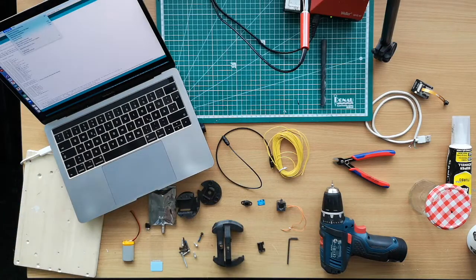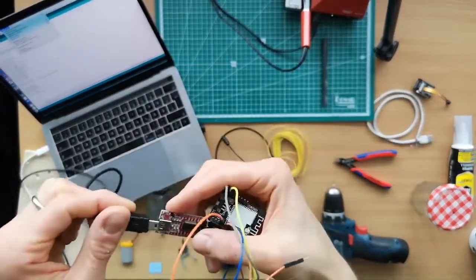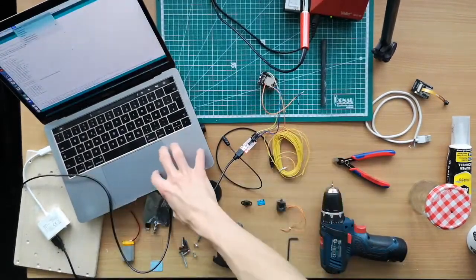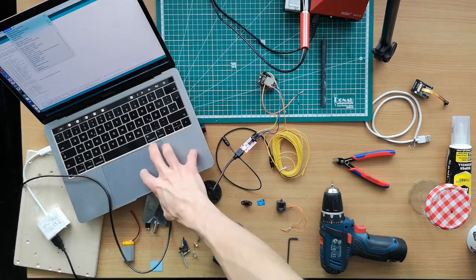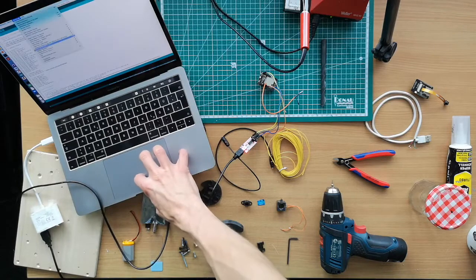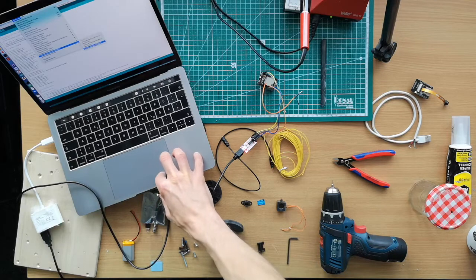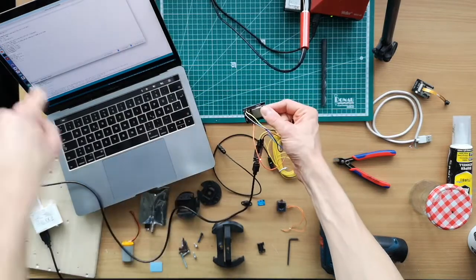In this case, it's a Mac system, but you can use any system there is. And I'm just doing that. So here we have the USB wire, and if everything goes right, we can start the serial, and then we can have a look at its output. So here in the Arduino IDE, you look for the serial port, and in the best case, you get prompted with the serial, which I don't see right now. In that case, it's a weird name, dev, cu, USB, whatever. So we hit that, we open the serial port, and then we can also hit the reset button. And if there's something appearing on the screen, then you are properly connected.